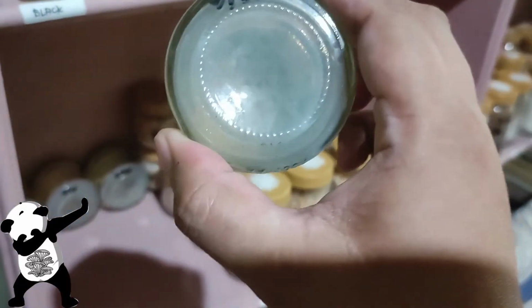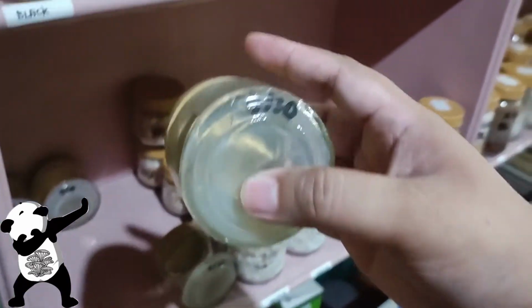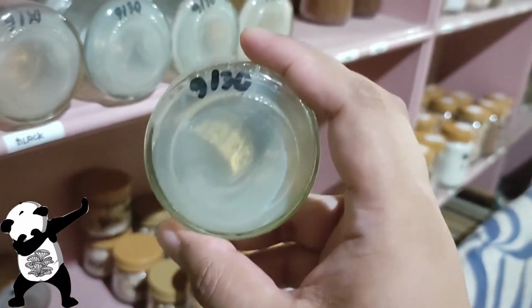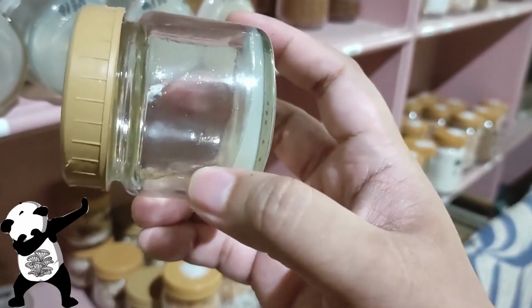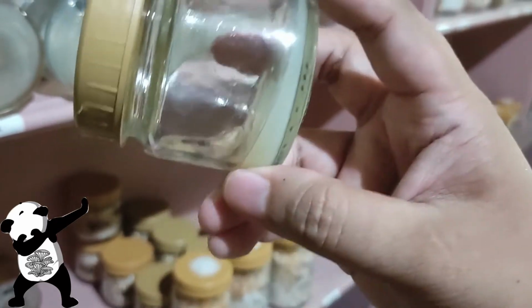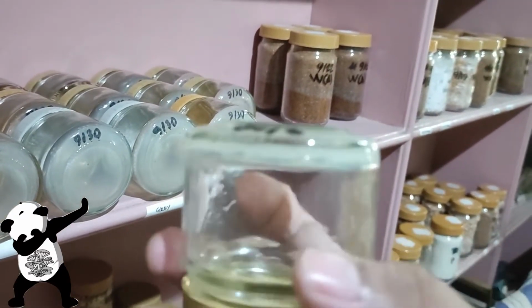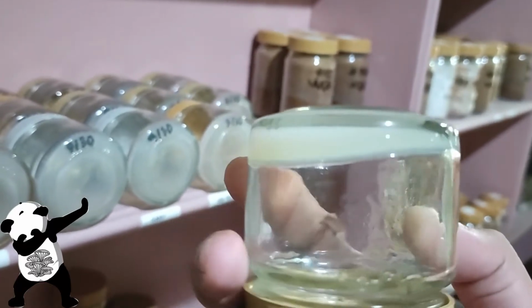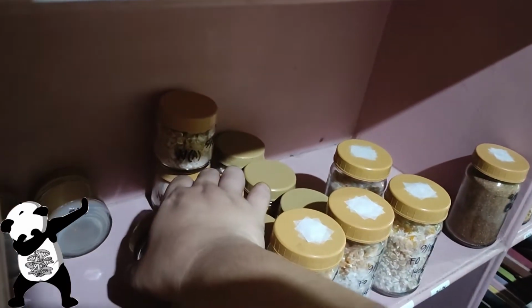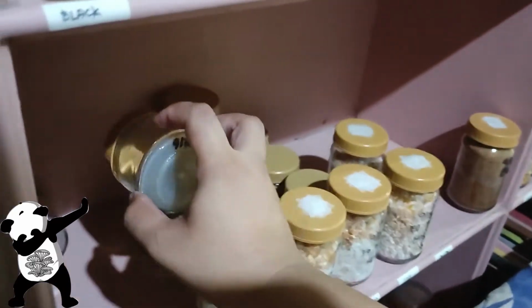Okay, last 4. Well, for this one, this is not contaminated. It's just that when I let the pressure cooker with the jars cool, I forgot to actually remove them from the pressure cooker before they solidify. So as you can see, this plate is actually inclined. Yeah, so it's my fault, but it's not contaminated. It's still clean and we can still use it. And yeah, it's really looking good.